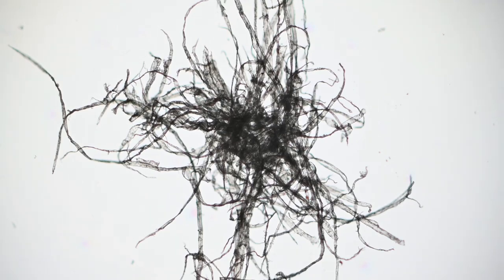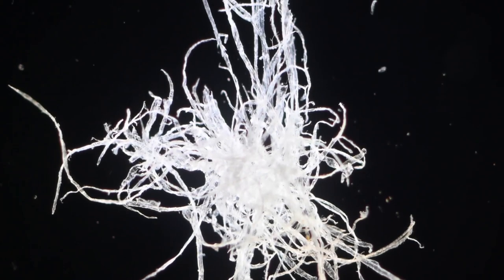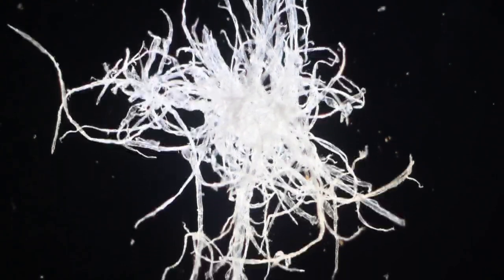Now for a sample like this, it's quite difficult to see the individual fibers like this, although you get very good contrast. But if you switch the microscope to dark field, microscopy captures only the refracted light from the sample, and the image would look very different. And here's exactly the same sample in dark field. So in dark field, because these fibers are so good at scattering light, the background can be completely hidden, and some beautiful images can be captured this way. And there's so much detail in such a tiny sample.